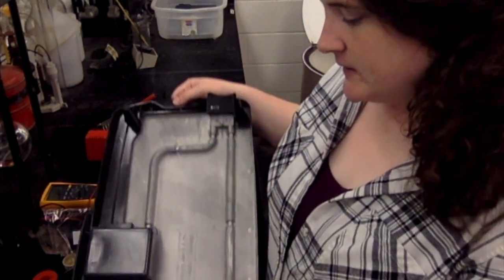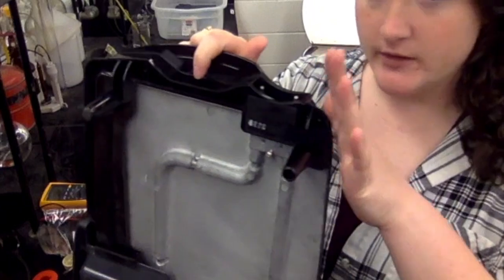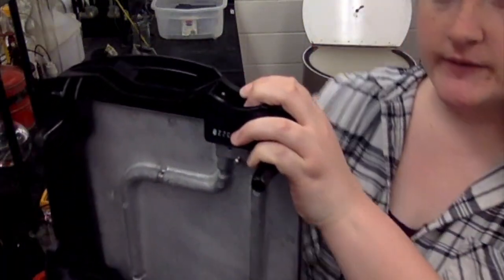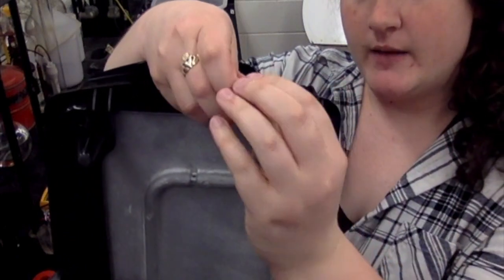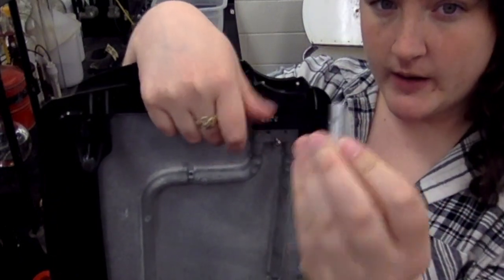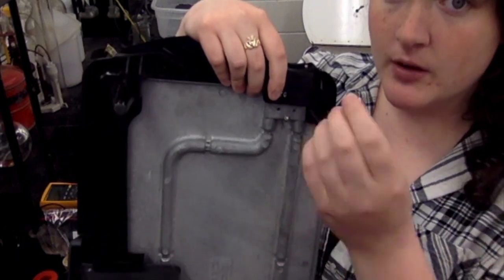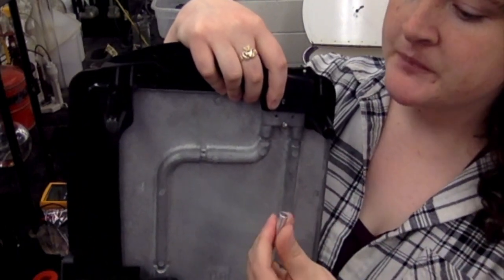Okay, so the last thing that we need to do is to mount the thermocouple into the griddle. And to do that, you're going to need to make a sleeve. This is what the sleeve looks like. It's just got a hole there. The purpose of that hole there is so that the set screw, which we've placed here, can go through that hole and then basically pin down the thermocouple in place.